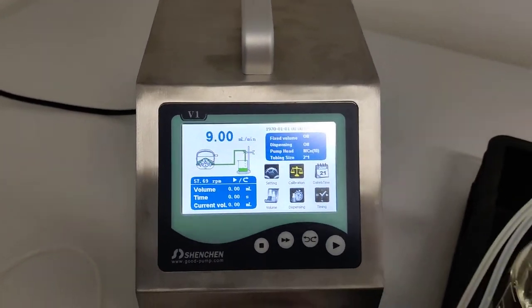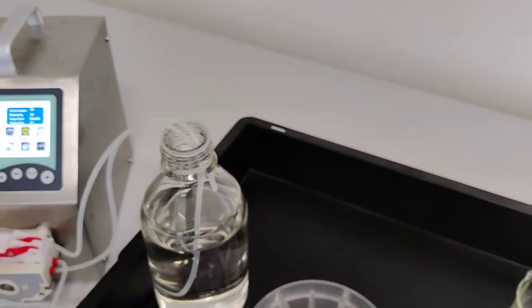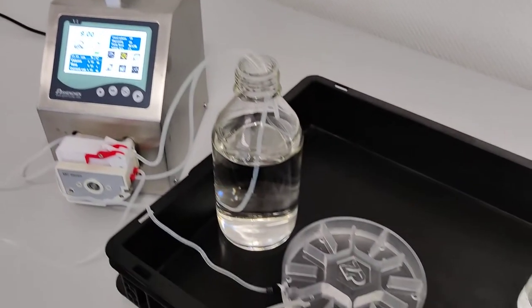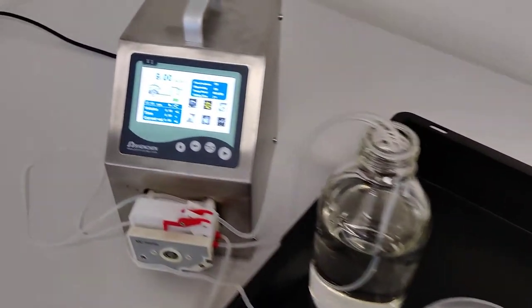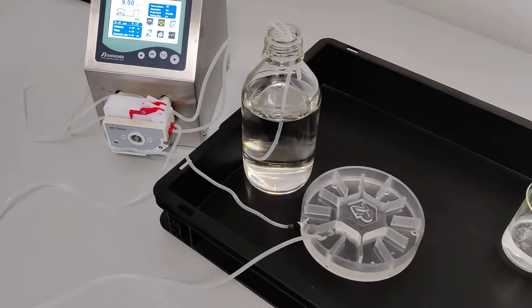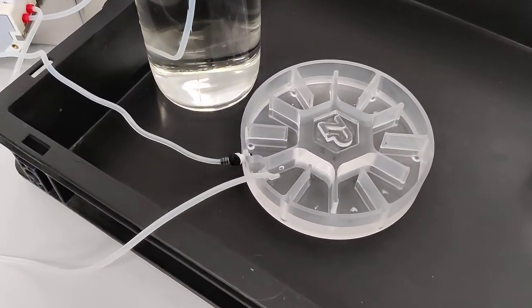This can be quickly changed, so it doesn't really matter in this experiment, but you can experiment with both higher and lower flow rates.